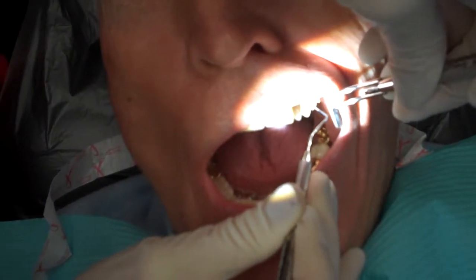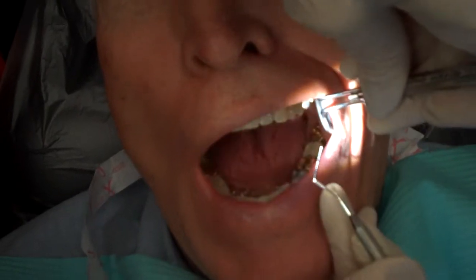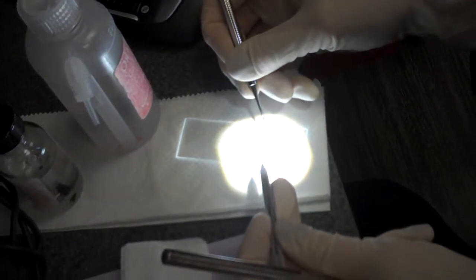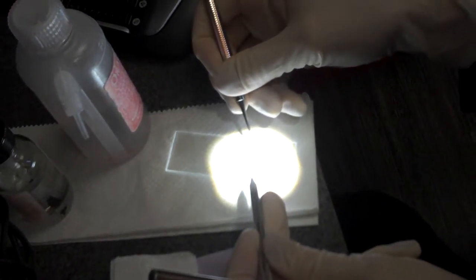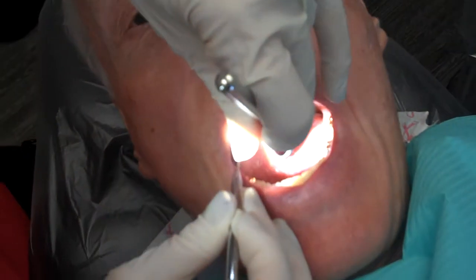That's a nice problem to have. But it doesn't take much — there's a tiny little bit on the end of my probe. With somebody with fairly clean teeth, you take what you can get. If you get a little tiny bit on there, that's usually good enough. It'll give you something. I'll try one other area — I usually do two or three areas.